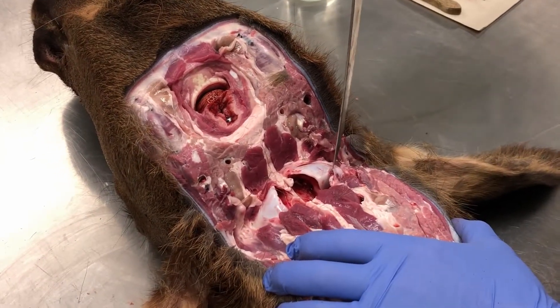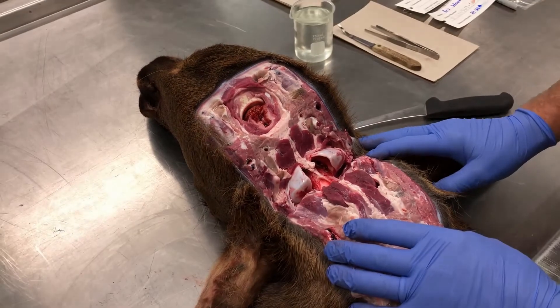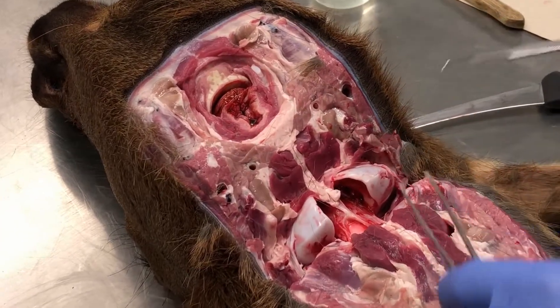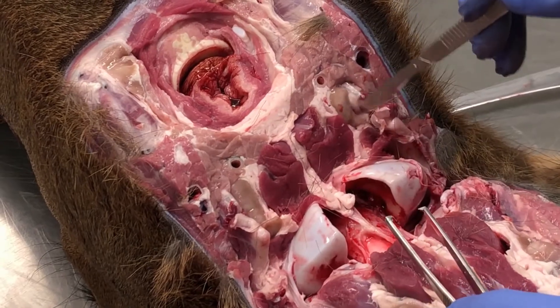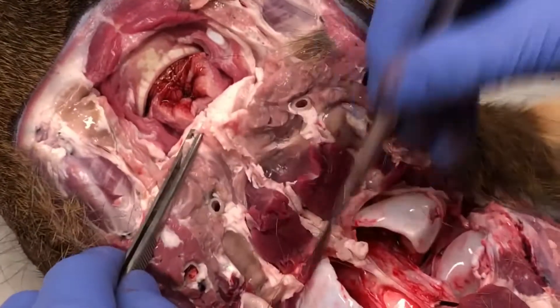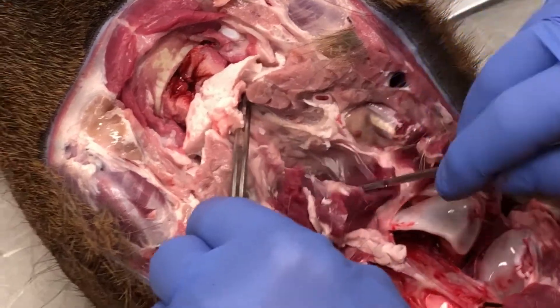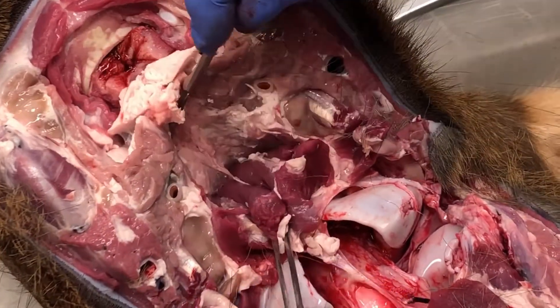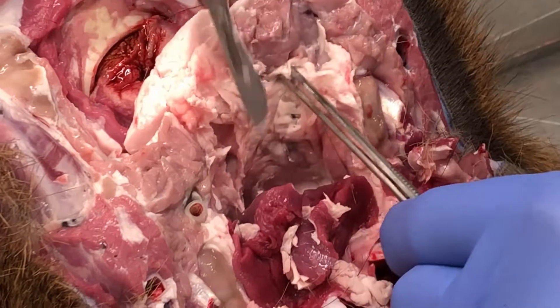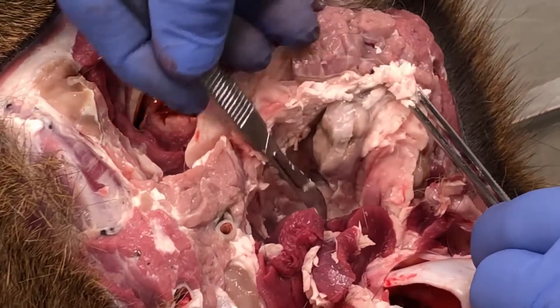So if you knock this down, just get it kind of out of your way and open this up. To start for the retro pharyngeal lymph nodes, you want to look at these two muscles right here — this is when I'll switch to my tweezers and scalpel. These are actually nodes here, but they're not the ones we need. You want to separate this muscle tissue from the tissue above it and dig down in here, basically creating this void. When you come down in here, you can see right there's a node. You're going to reach down and use your scalpel to peel this retro pharyngeal lymph node out.